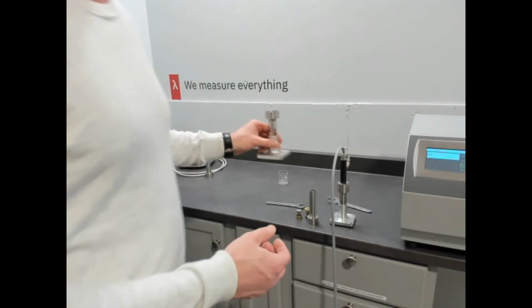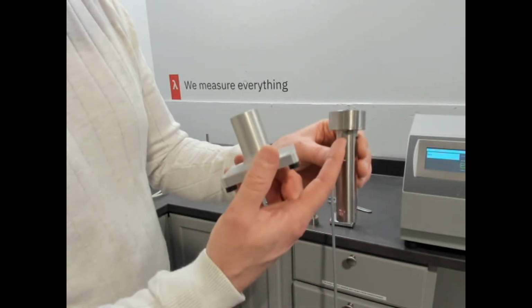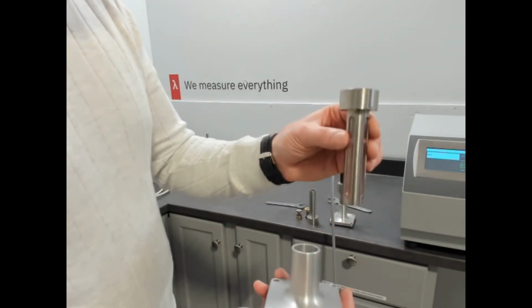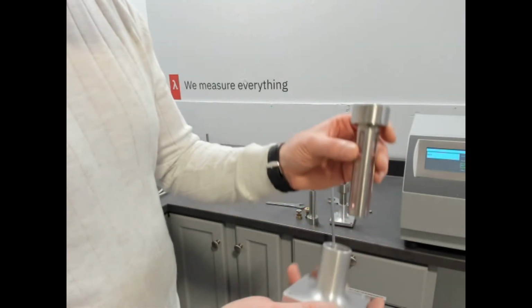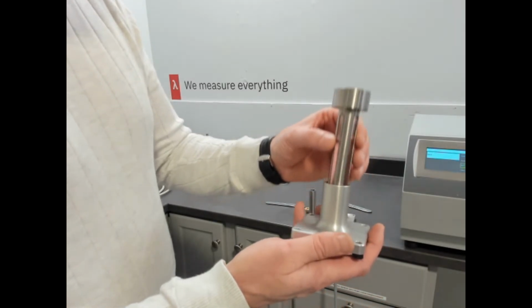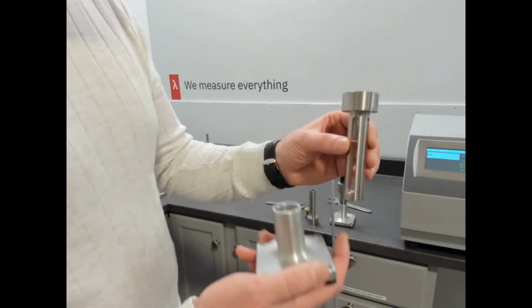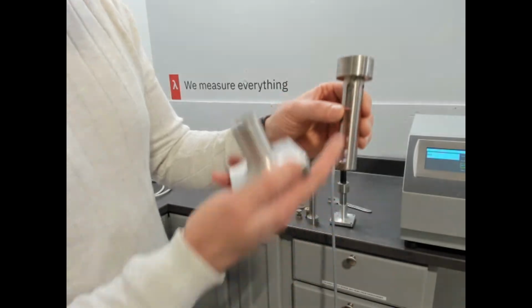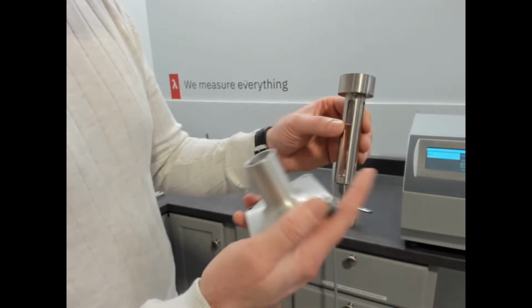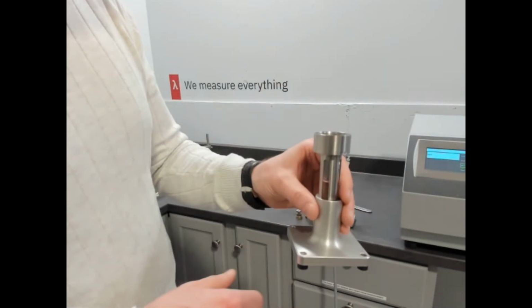The other cell that you can get for it is an observation cell. So this would be with a glass container, same connecting portion on the top. This is good for if you want to see if you have phase separation or settling of micron or nano size particles. You can make some measurements and see the change, both thermal conductivity, thermophysical properties, as well as inside the cell. So that's what we call our observation cell.